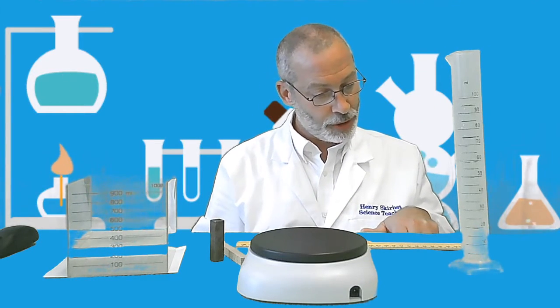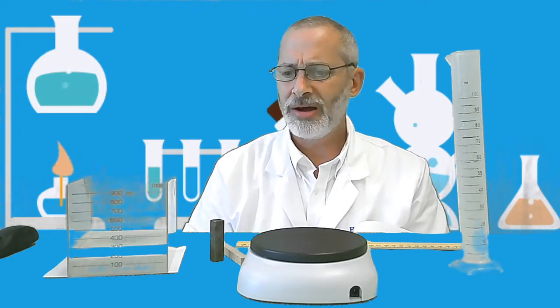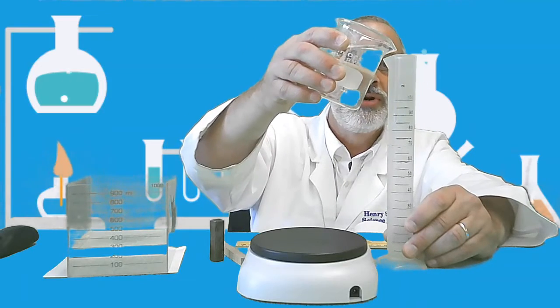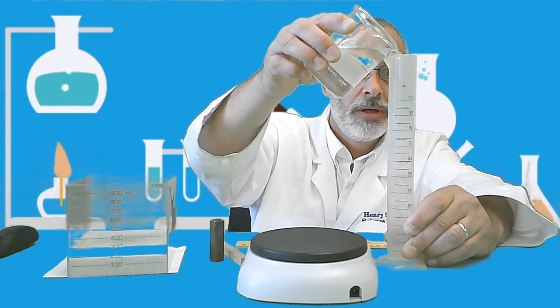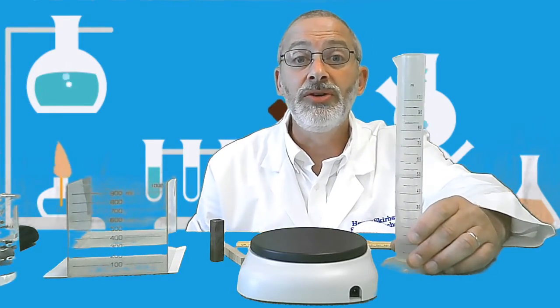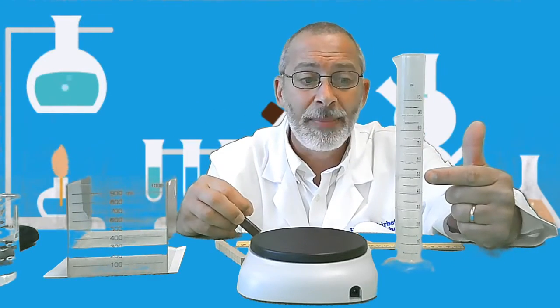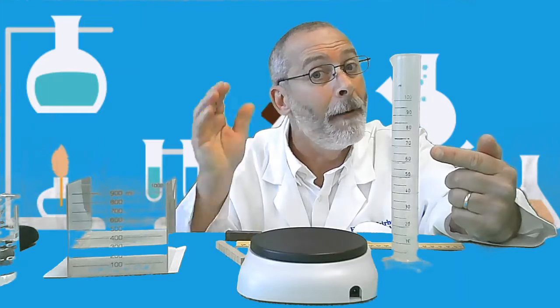Next, determine the volume of object B by using the graduate. How are we going to do that? Well, we're going to use the displacement method. Remember Archimedes from Monday? So we're going to put a certain volume of water into our graduate. I'm going to put 50 milliliters. There we go. 50 milliliters of water into our graduate. Then I'm going to place the object into the graduate. And as we do that, what do you think is going to happen to the volume of water in the graduate? Do you think it's going to stay the same, go down, or go up?